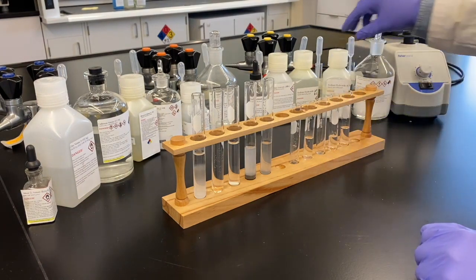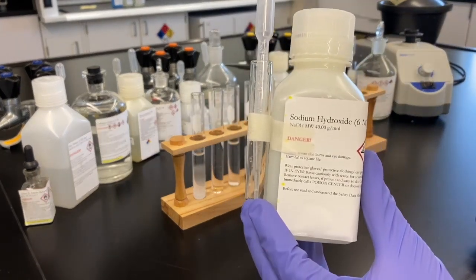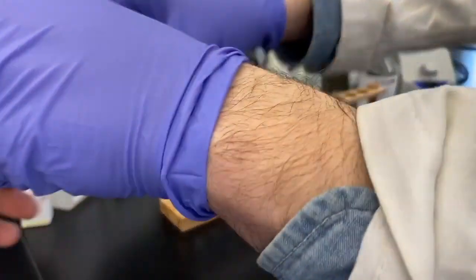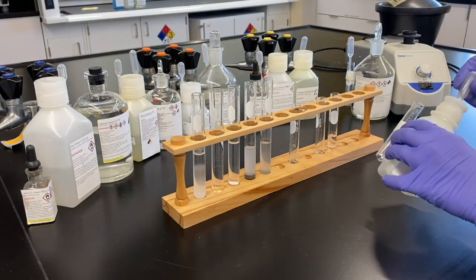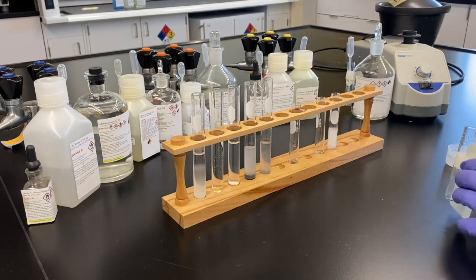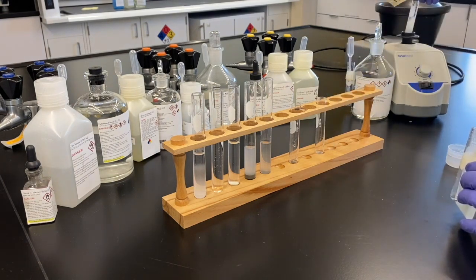So we're going to test this supernate, see if that cadmium is present by adding our sodium hydroxide. A higher concentration of it, 6 molarity, just because we were adding highly concentrated acid in some of these earlier steps. We don't want to waste a lot of time trying to neutralize it, so we're just going for the big guns. And there we see our precipitate form. So confirmation, cadmium is present in our unknown mixture as well.